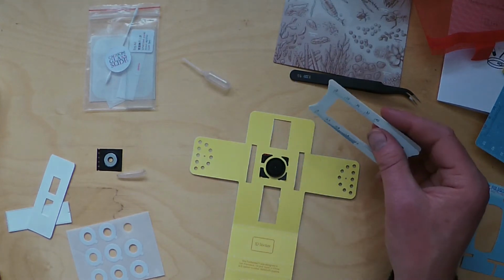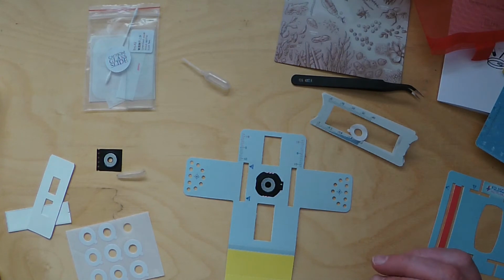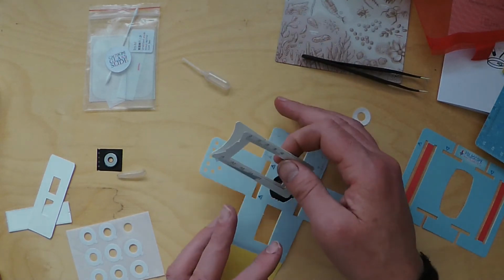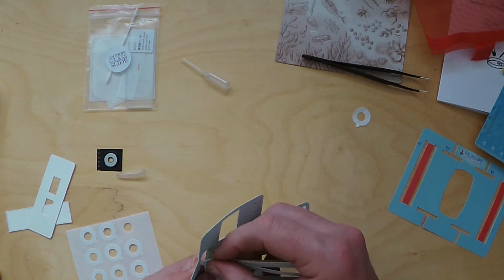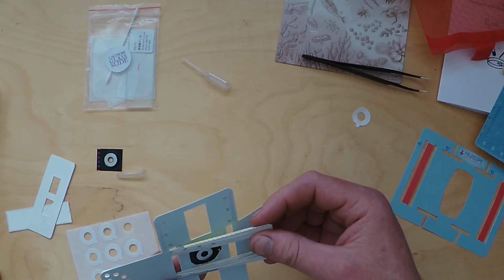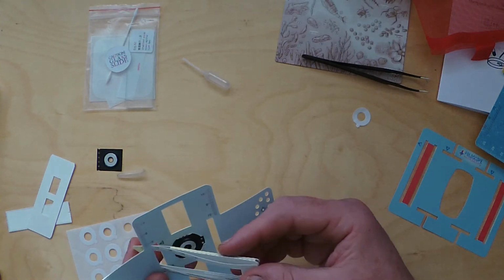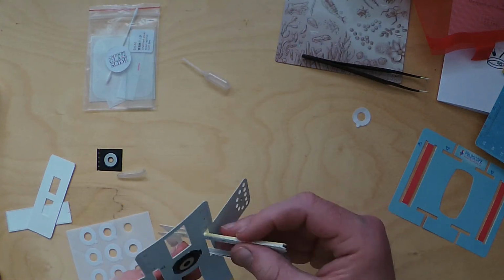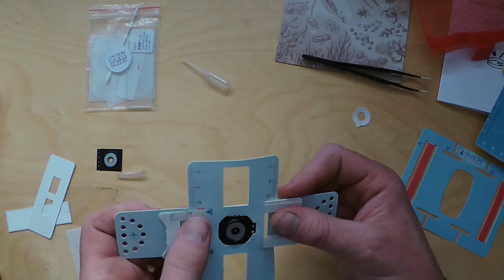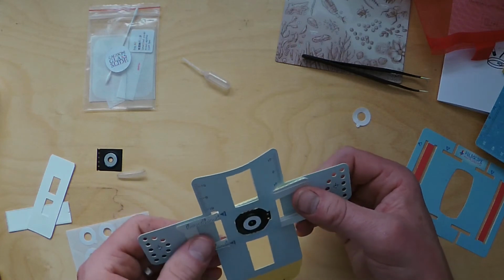So you need to put this into our lens stage. So we're now on point 6 in the instructions if you're following along. So let's pop that in there. Turn this around. That goes in there and then it threads back through there, so you'll end up with that little Z, i.e. the up and down distance, Z arrows pointing to those numbers there. Okay.